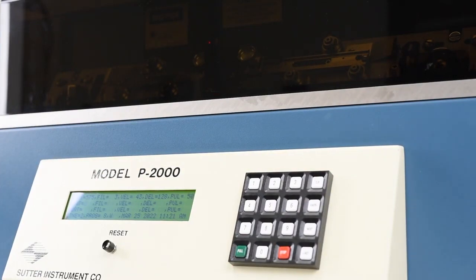Pressing the green Pull button will initiate the pulling process. The fan will turn off and the laser will turn on, causing the red Laser On light to illuminate. The puller will then run through the lines of the program written in order.